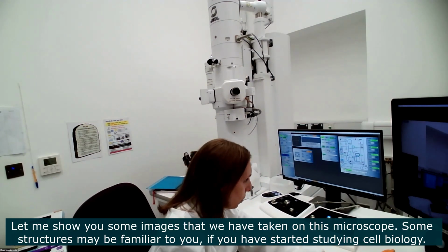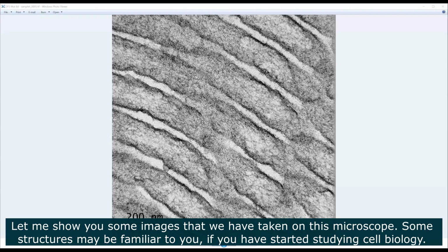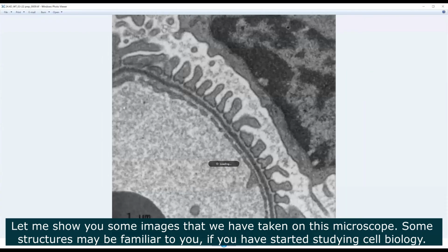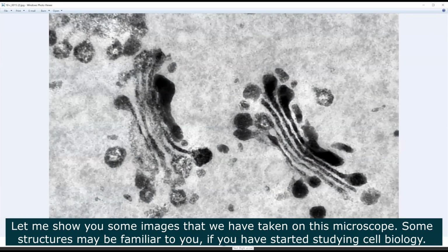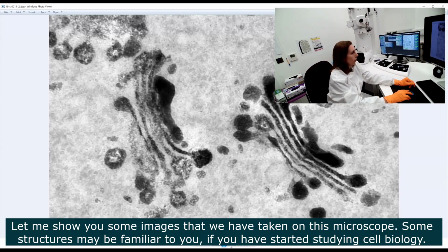Let me show you some images that we have taken on this one. So these are some images we've taken on this microscope. Let me just go back a bit. And you see some things that may be familiar to you guys. Parts of the cell that you might have learned about in your cell biology classes.